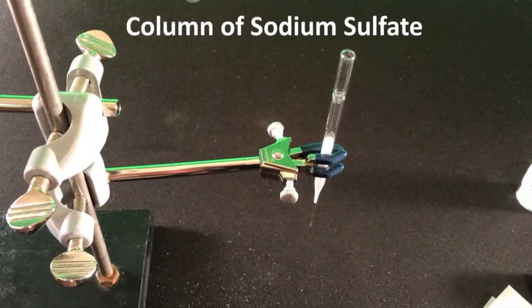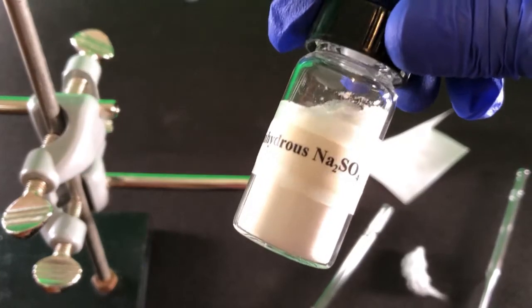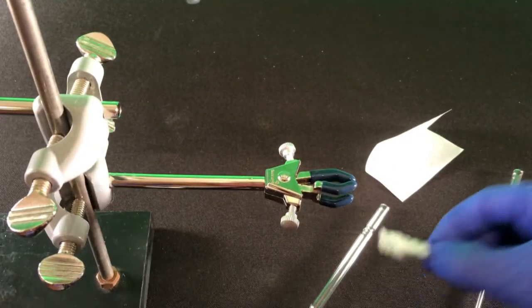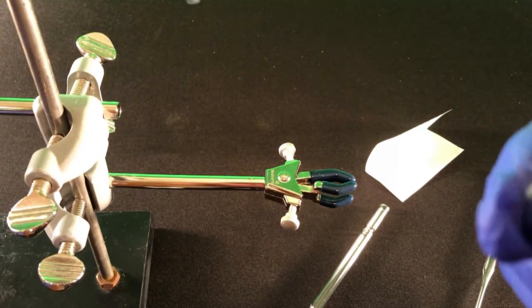We will do this by passing the organic layer through a small column of sodium sulfate. The column we will use is a short Pasteur pipette with approximately 250 to 500 milligrams of anhydrous sodium sulfate, roughly 2/3 of the pipette. This is a granular salt that looks like sodium chloride. To prevent it from falling out the bottom of the pipette, plug the pipette with a small amount of cotton.